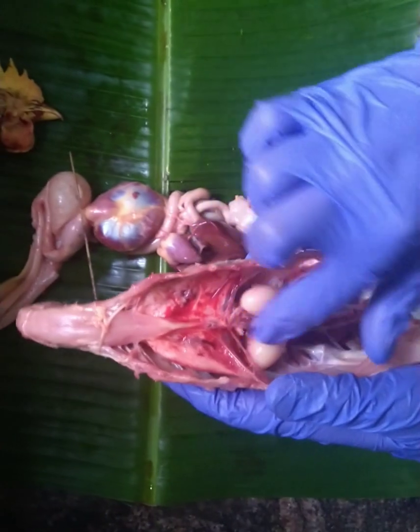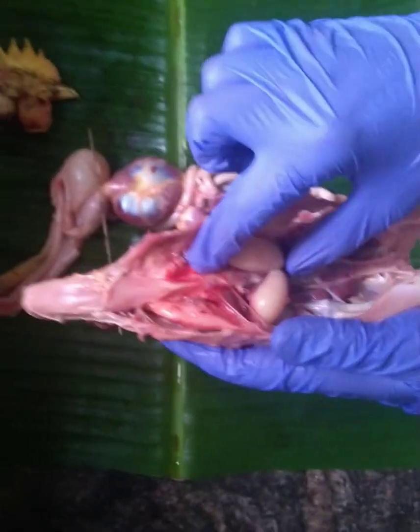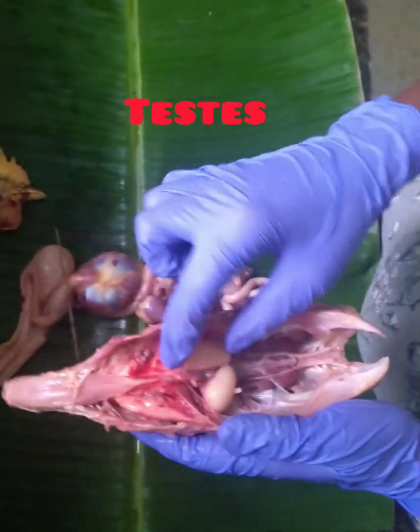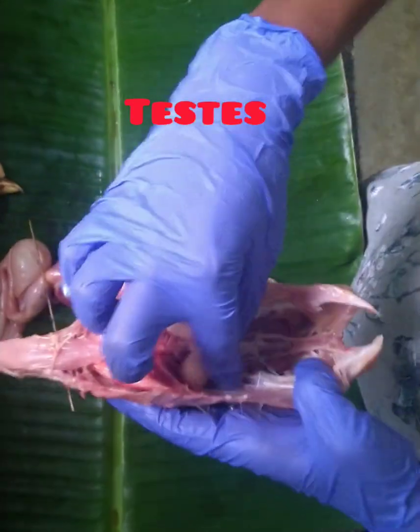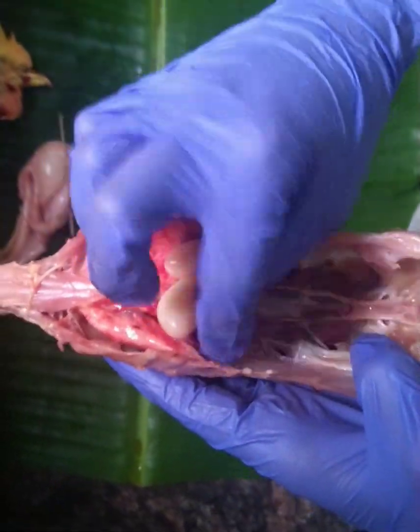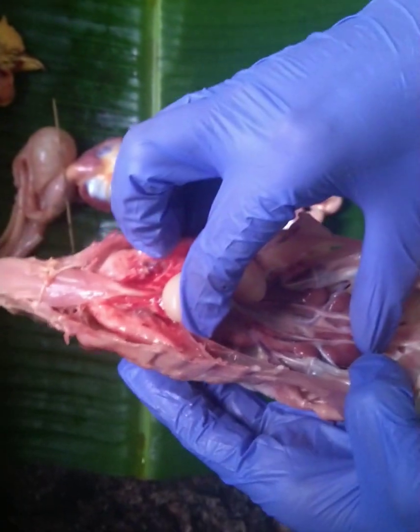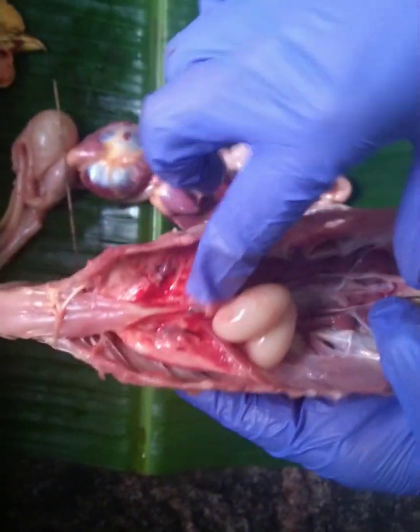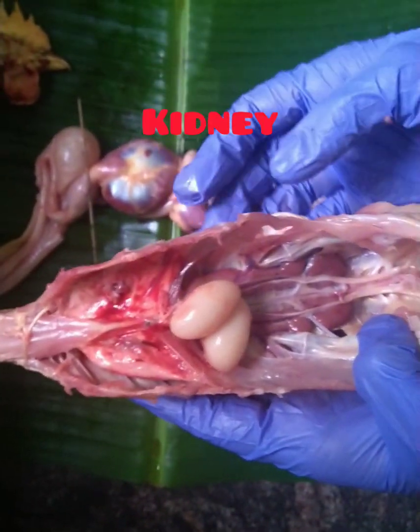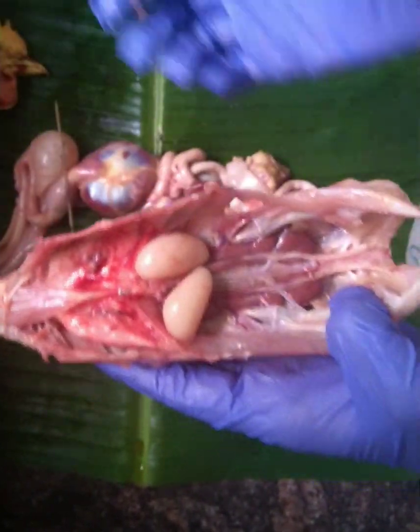These two white structures we see here are the testes. And extending below on both sides, the brown structure we see here is nothing else but the kidney.